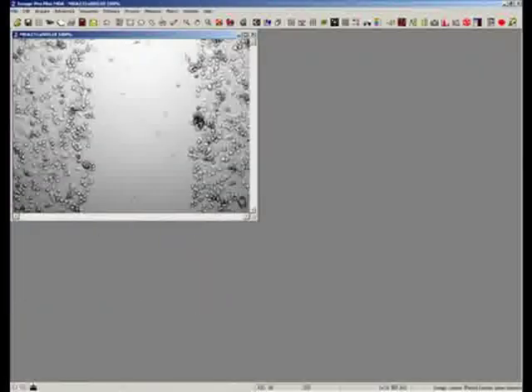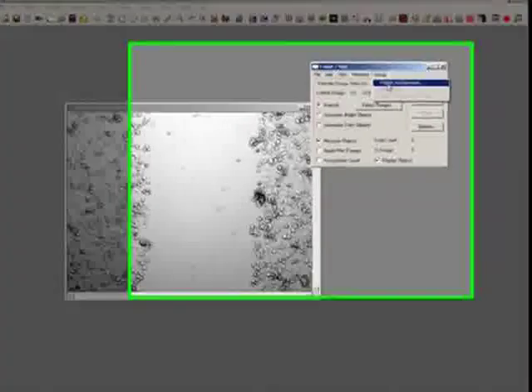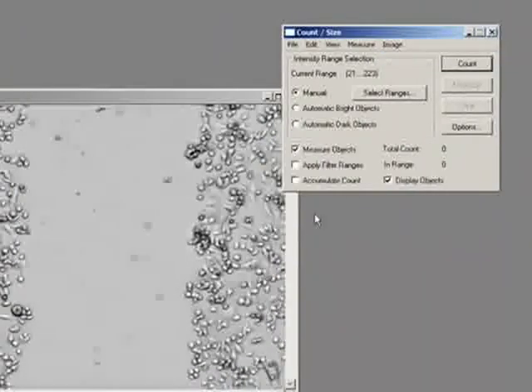This is a quick movie just showing you how to do some wound healing inside Image Pro. I'll just open up a wound healing image. This is pretty classical. Most wound healing images tend to be phase, and they tend to all have illumination issues. This seems to be the standard problem I have. So you can set up your microscope with Köhler illumination, which can be found on the web, or we can just do from the count size dialog, flatten background, bright background, okay, and that seems to even everything out.